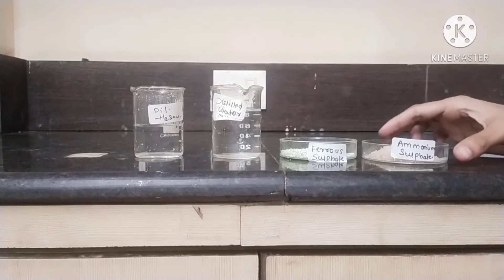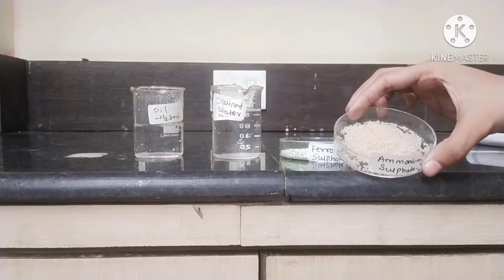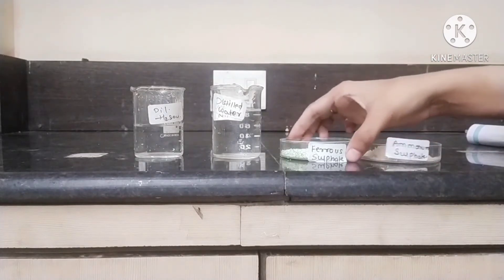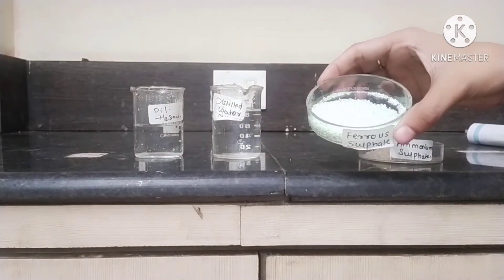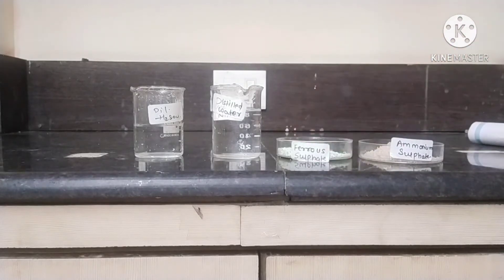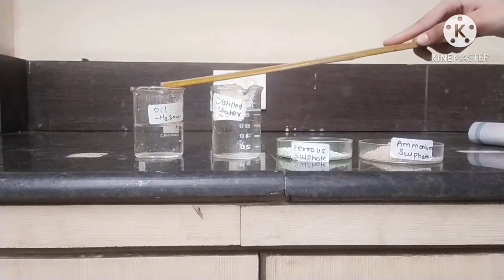Chemicals required in this experiment are ammonium sulphate, ferrous sulphate, distilled water, and diluted H2SO4.